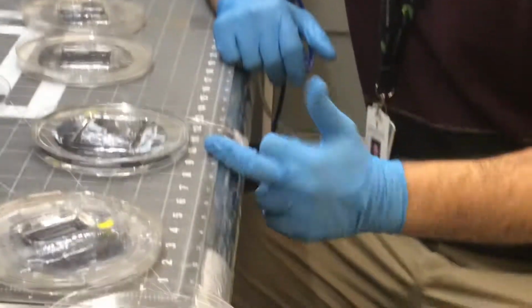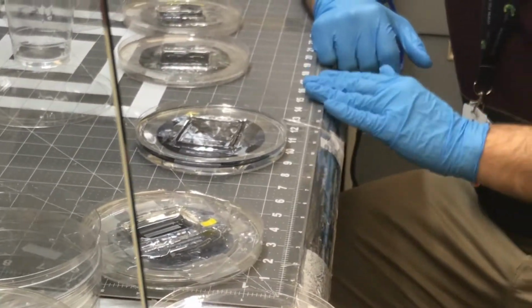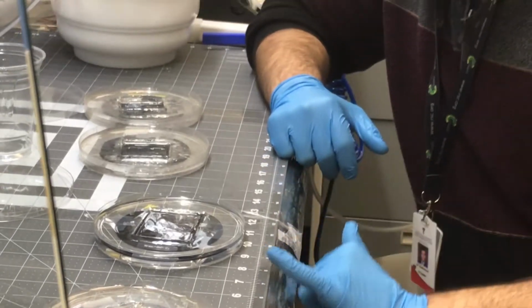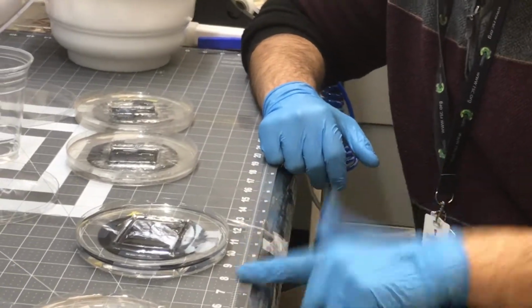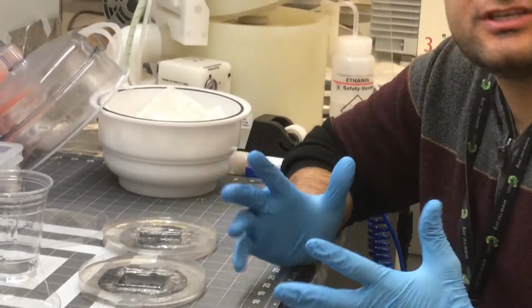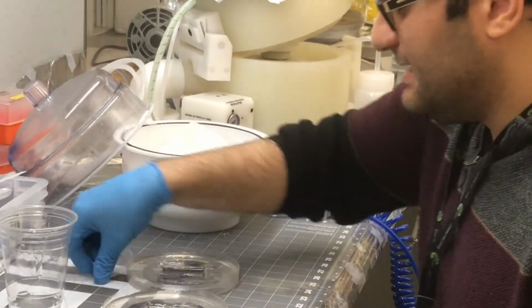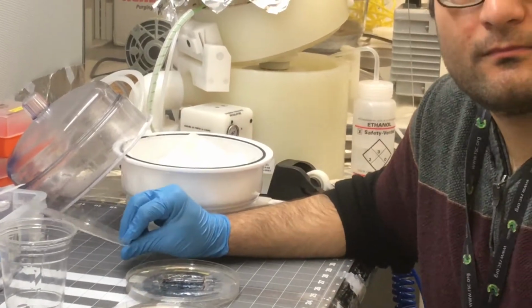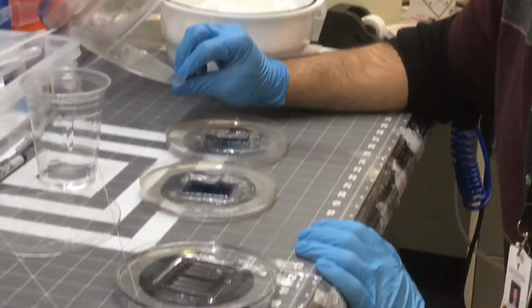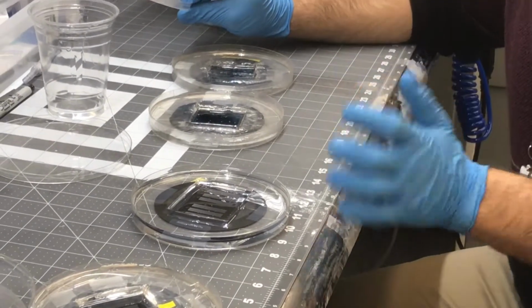And then you should optimize your height. For example, if people mention a 3 millimeter height, the first time you run the chip, you use 1 millimeter, 3 millimeter, 5 millimeter, 10 millimeter, and see which one you can use. After that, you optimize based on your situation and your material. This height you control by how much PDMS you put on the master mold.